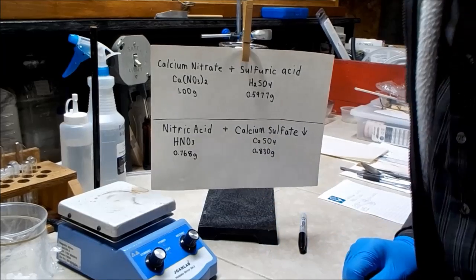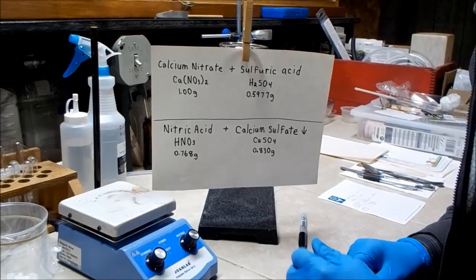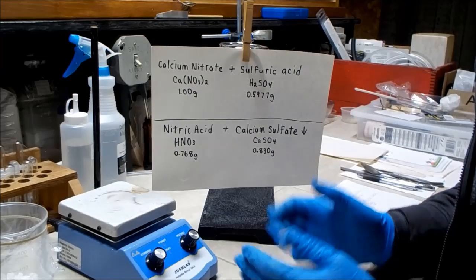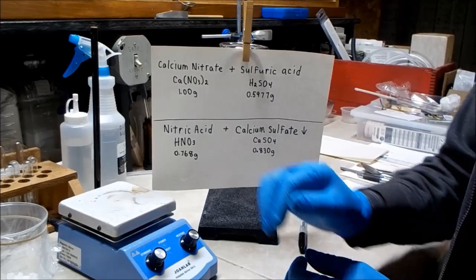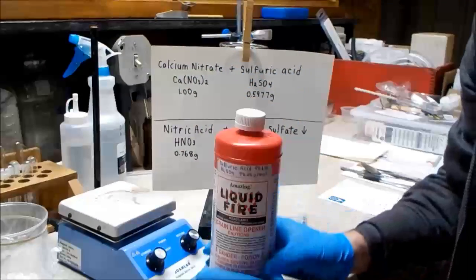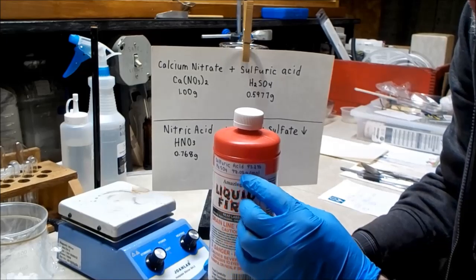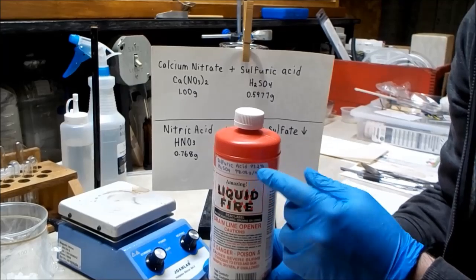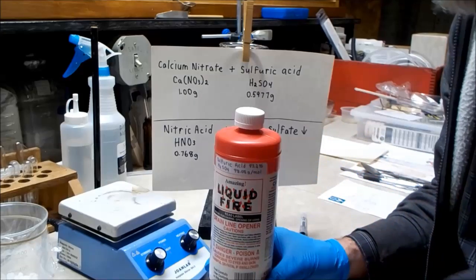Now for this reaction to work without a lot of byproducts contaminating your acid, you're going to want to balance the amounts very carefully. I have my sulfuric acid here in this drain cleaner. The literature that I could find online about it says it's 93.2%, which is a very accurate number to have, but I've never verified that. I'll be trying to verify it.